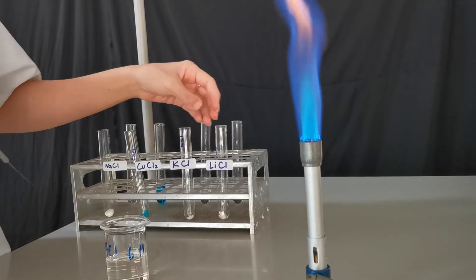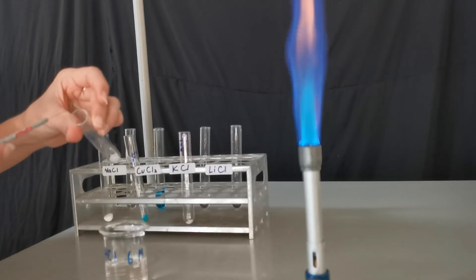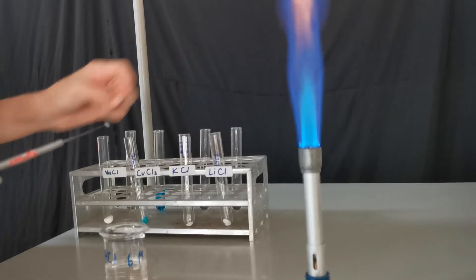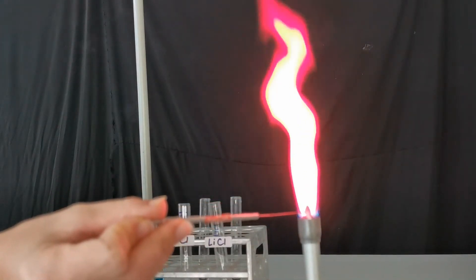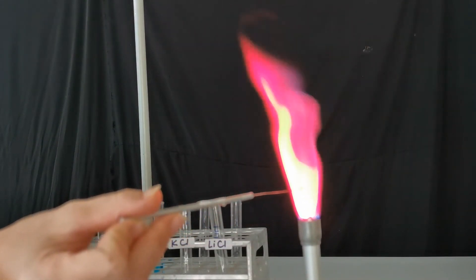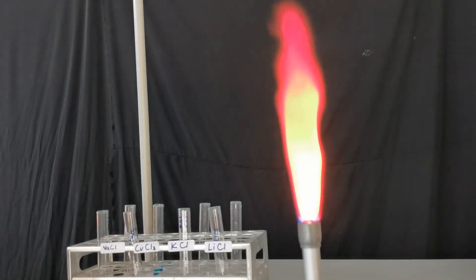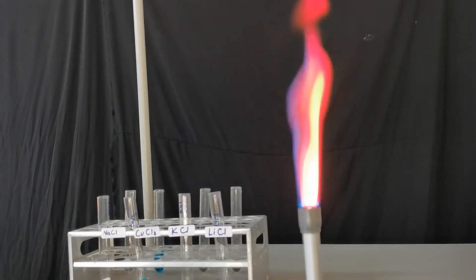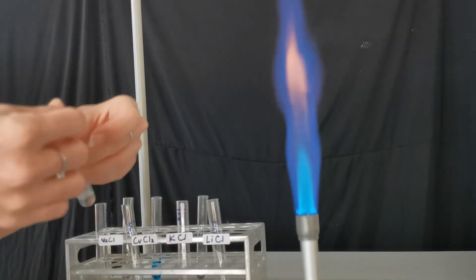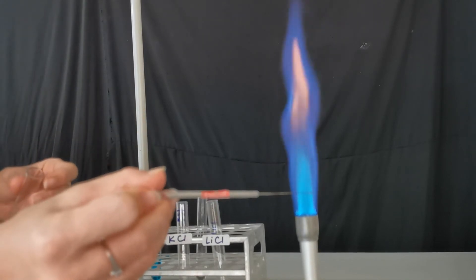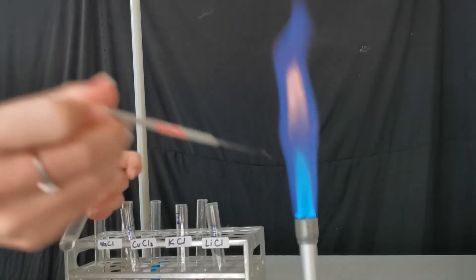The next test that we will do is lithium. I'm going to leave potassium to the last one. Lithium gives you very bright red color. I dropped some crystals there. Lithium solution now. Very nice red color.